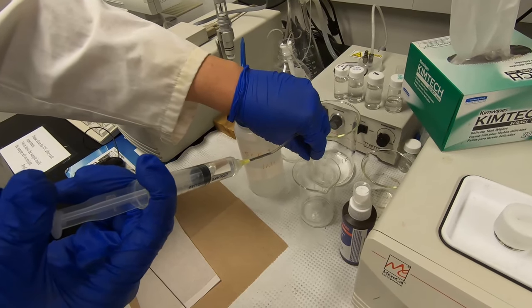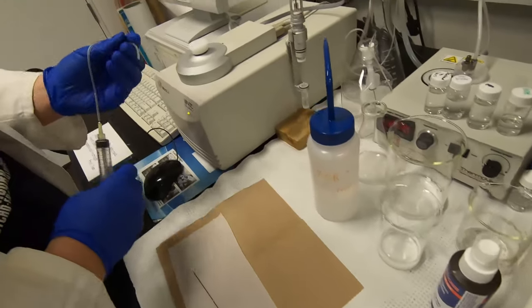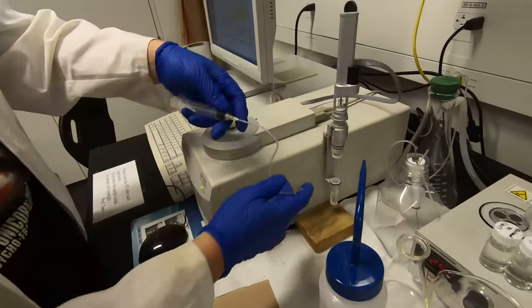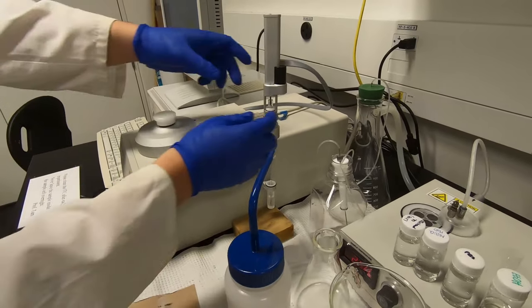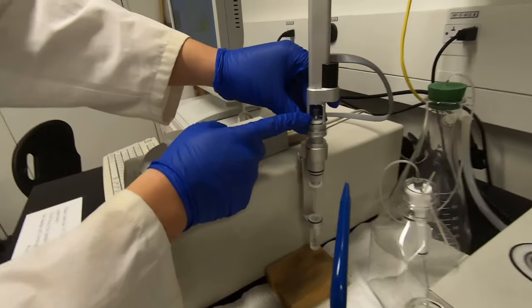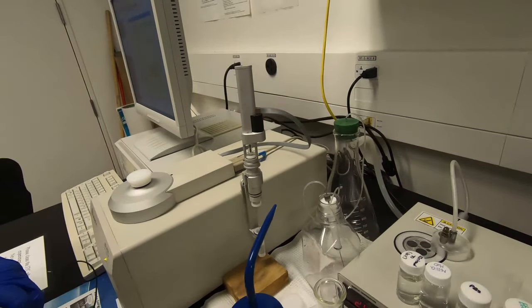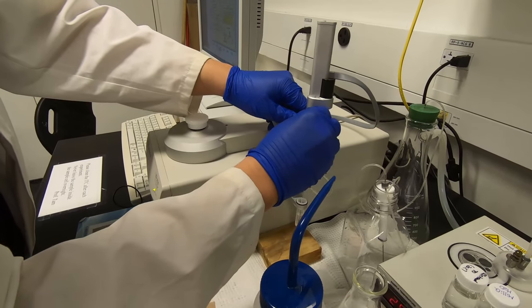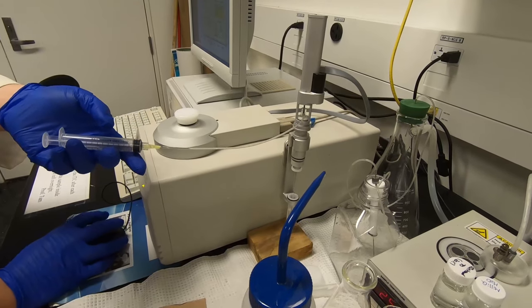Sometimes it's the surfactant solution you use to clean the syringe. Then repeat — connect here, draw the water up, add water, and flush it with water. If you see contamination at the white plug, you need to disassemble the injection syringe. The first step is to open the fill port and remove all the water or cleaning agent inside the syringe.